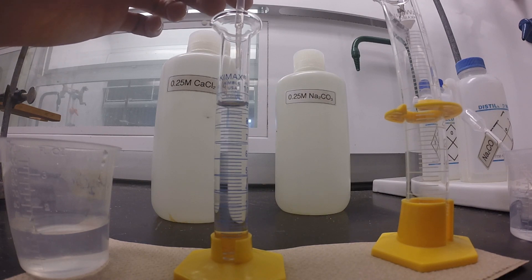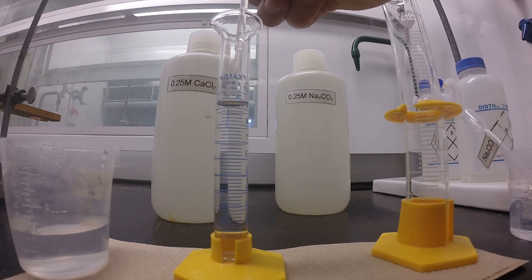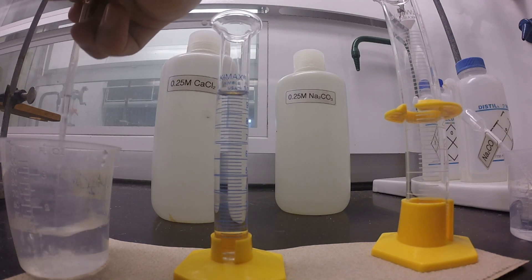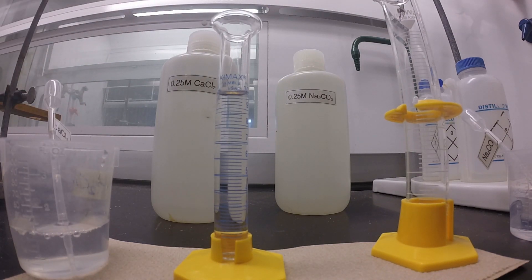You can see here we now have 10 mL of our calcium chloride. The camera doesn't do it justice - I had the camera looking up at this so it looks a little off, but in person this was 10 mL on the dot.